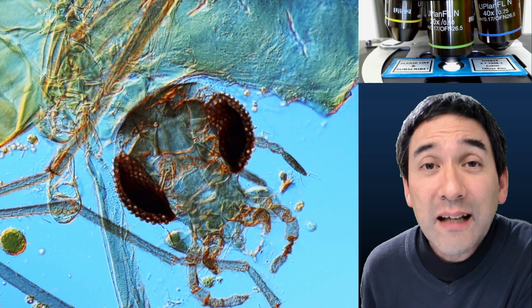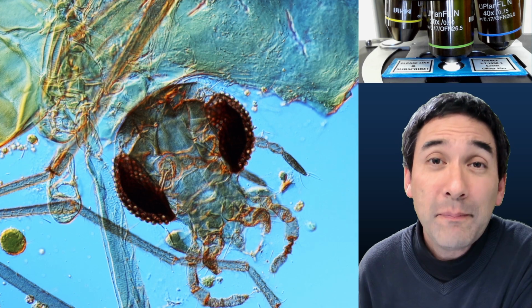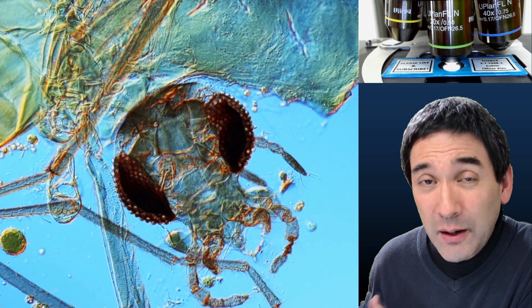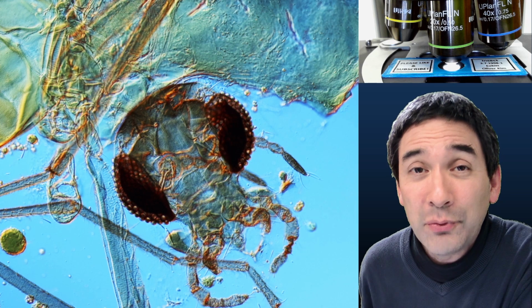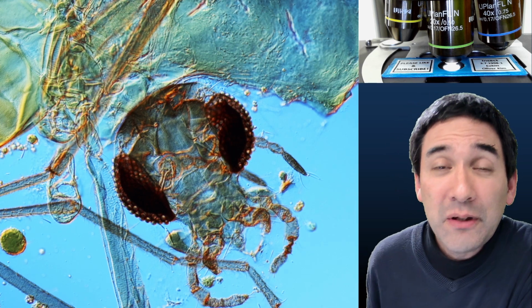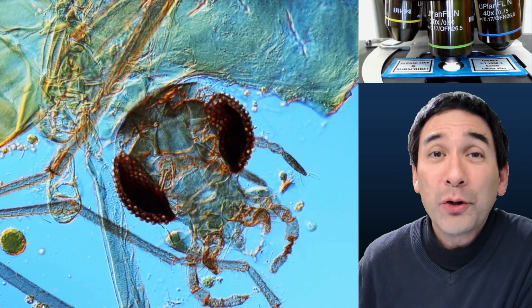And the second thing that the alcohol does is it actually disinfects the specimen, and it will remove any bacteria and fungi that might decompose it. Do not forget that many mounting media are not water soluble. For example, here I used the mounting medium Eukitt. It's a very fast drying resin-based mounting medium, a very popular one. However, it does not allow water to evaporate easily.